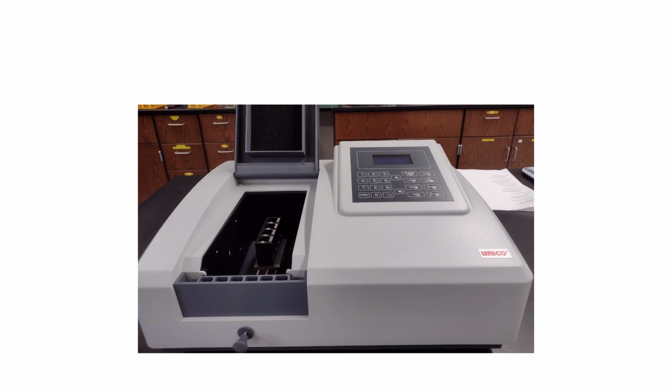Now, what a lot of people do, they feel it's more accurate to measure the percent absorbance, which basically is the inverse. How much of that light is absorbed or does not pass through. And so it's inverse of the percent transmittance. In other words, it's going to be opposite. And so typically that's what we record is the absorbance. So that would mean the number is going to go higher because more light is being absorbed and it is not allowed to pass through, the cloudier the substance is.